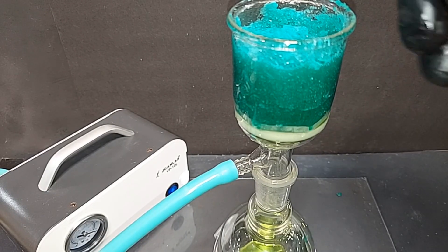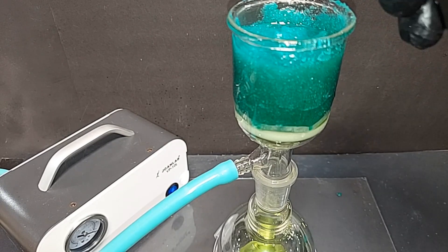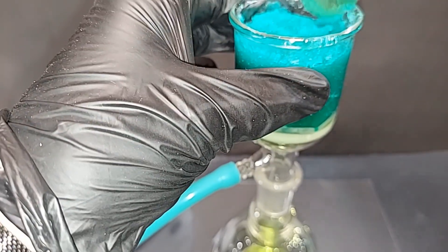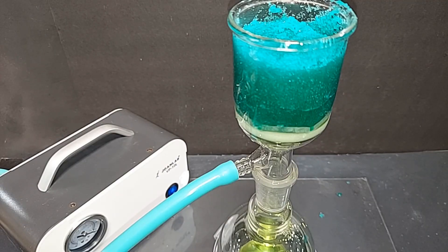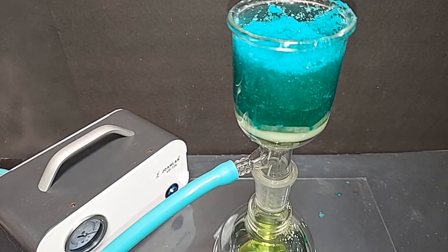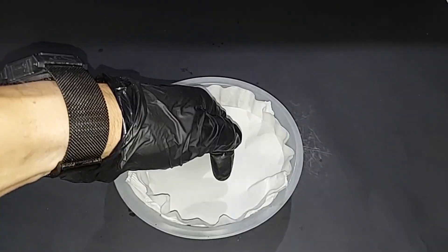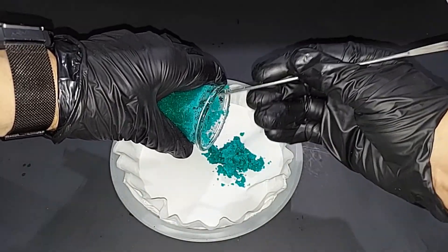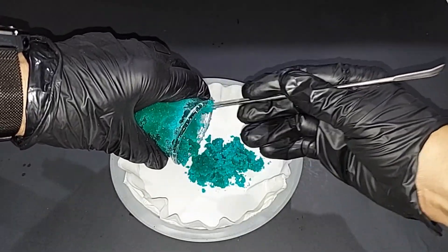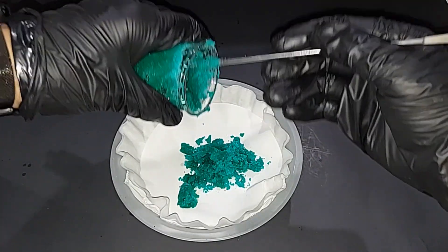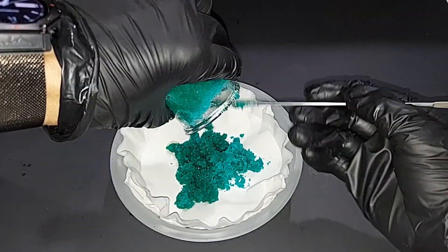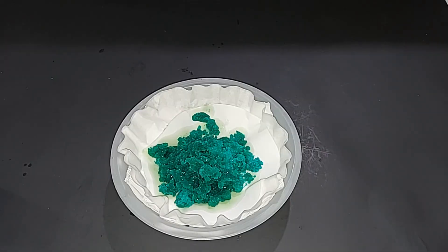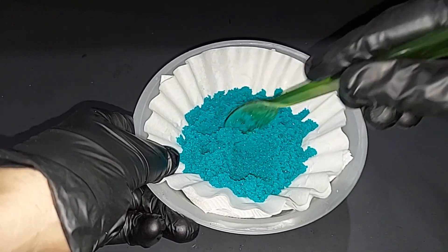And a second brief washing with 99% isopropyl alcohol. Nickel sulfate is not soluble in this at all, especially when it's cold like this is. Both the water and the isopropyl alcohol have run through, so I'm going to turn this off. We'll scoop it out and we'll dry it. This little plate here just has some paper toweling and a couple of filter papers. We'll start putting our nickel sulfate in here. This is one of those things you do not want to heat under any circumstances because to heat and dry this means you release the water and in the end it just turns into mush. So we'll have to be patient and let this air dry.